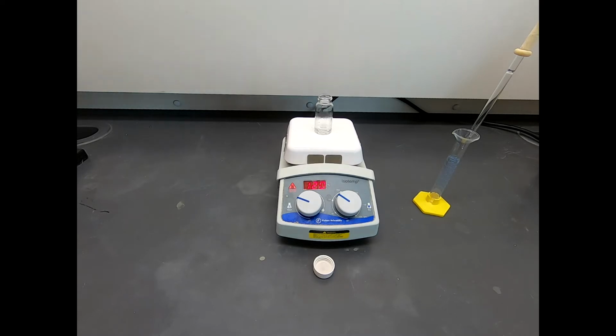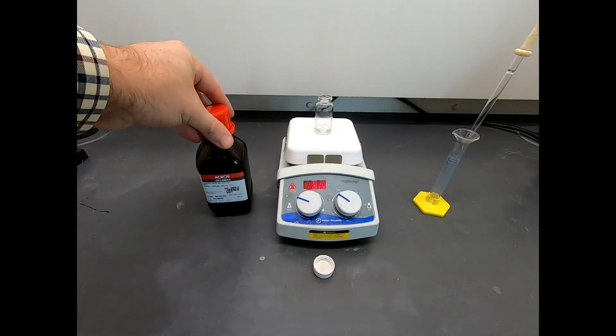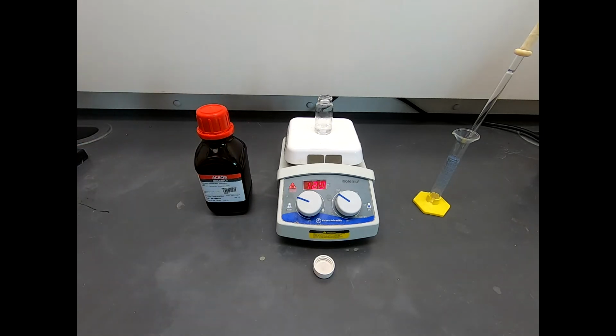If we have a little more catalyst, a little less, it's probably not going to make a big difference. But we just want to make sure that there are some acidic protons in there at the beck and call of our reaction in case our reaction wants it. Now, what we have last, let's bring it into frame, is our hydrazine. Very often when you set up a reaction, the last thing you add is typically the most reactive thing. It's not always true, but very often is. And hydrazine, as our reagent, is the most reactive thing.